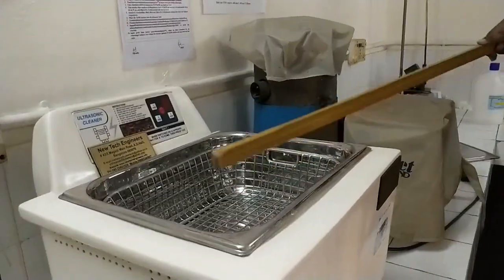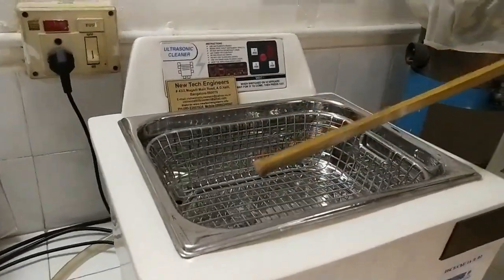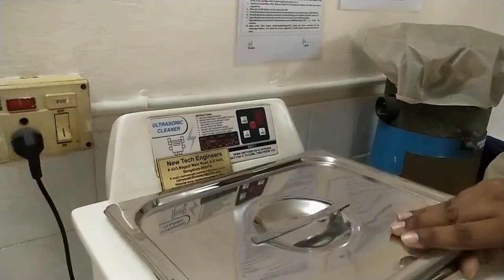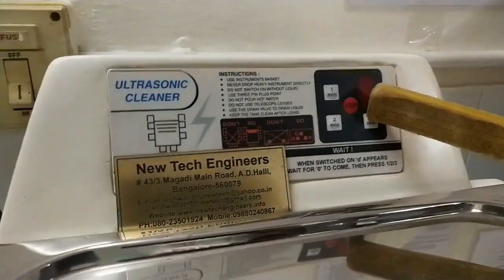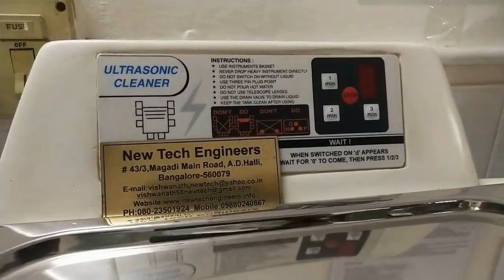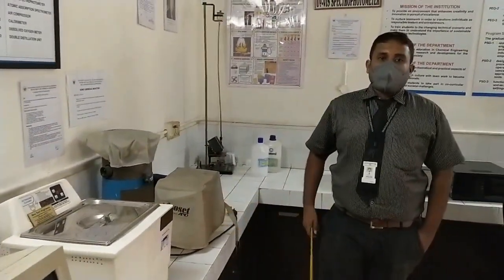saponification reaction. In this setup, initially we need to fill water and place the beaker at the center, and the lid will be closed. Once the setup is arranged, the lid will be closed and the experiment will be started. At different time intervals, at an interval of 3, 6, 9, 12, 15 and 18 minutes, we'll be collecting the samples and making the titrations. For that we need to see the preparation of solution.